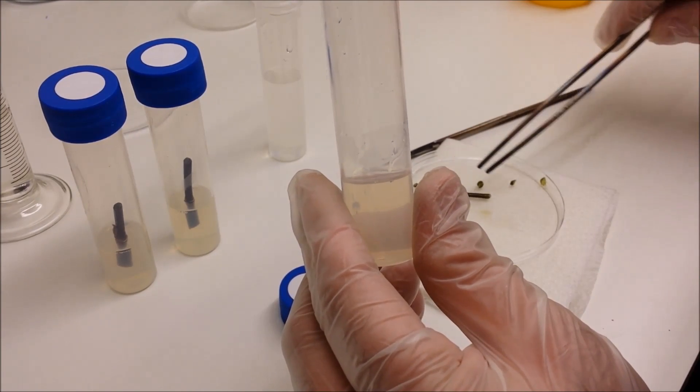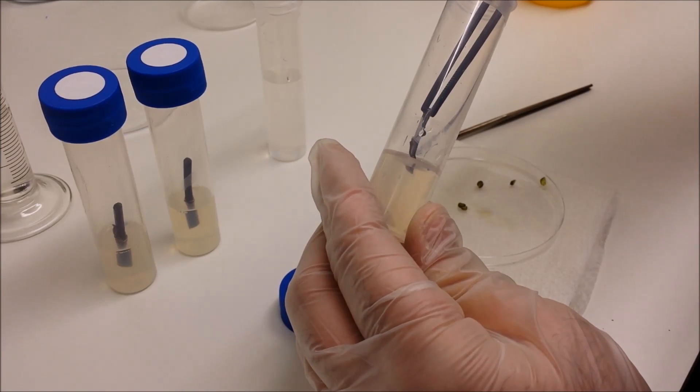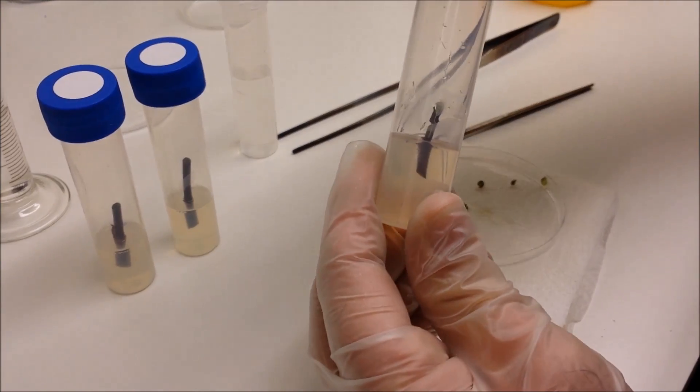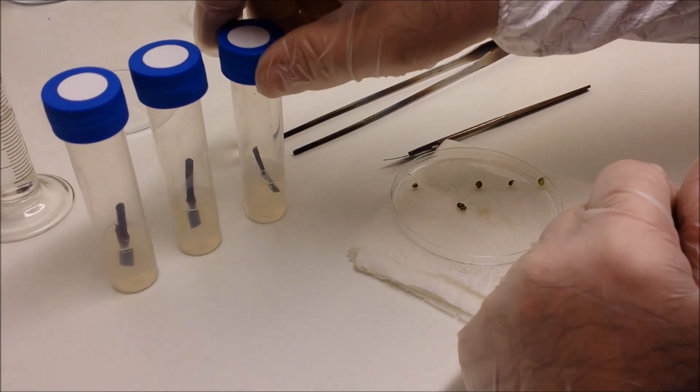So here we go, this is the last one. In, and just rest that bud just on the surface or just above the surface. And that's the process complete.